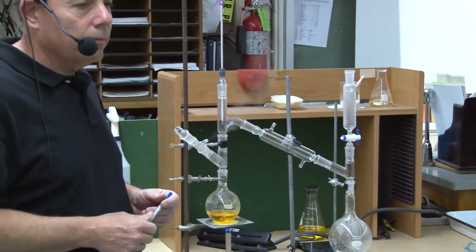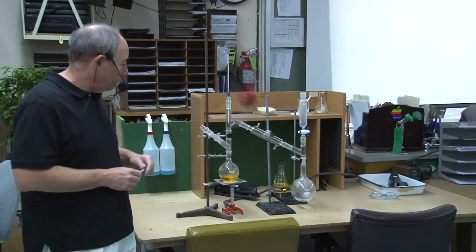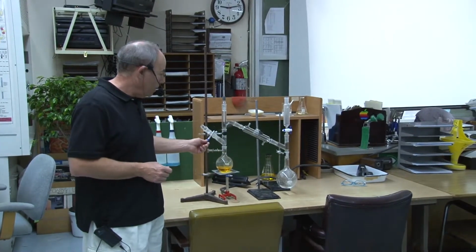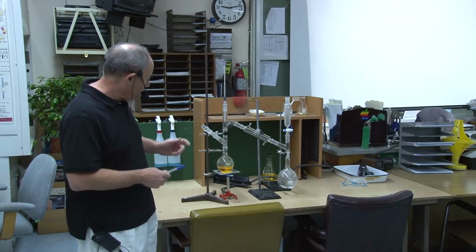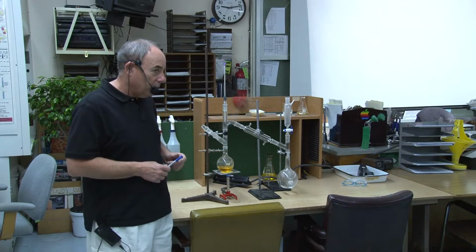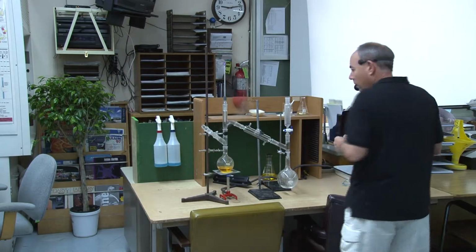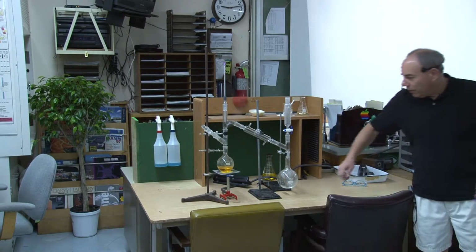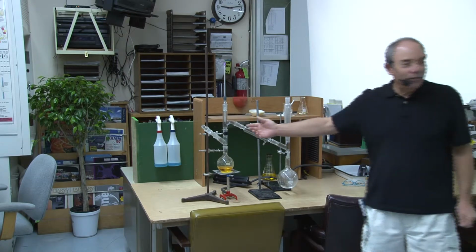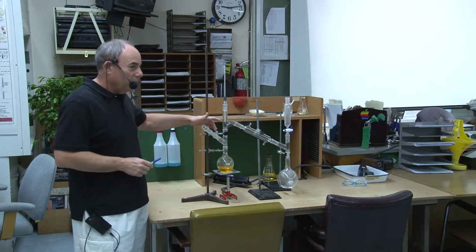David? What's with the vents to the left of the, what is it, this vent? No, right, over the, which chamber is it called, the flask with the? That's the receiving, that's the boiling flask and the receiving flask. The one over that, isn't it losing some water? All right, you're talking about this? No, the one that has the thing. You're talking about here? No. Where? The vent that's like. Oh, this one here, where it's losing. Yeah. This one. Yeah, wouldn't that be a?